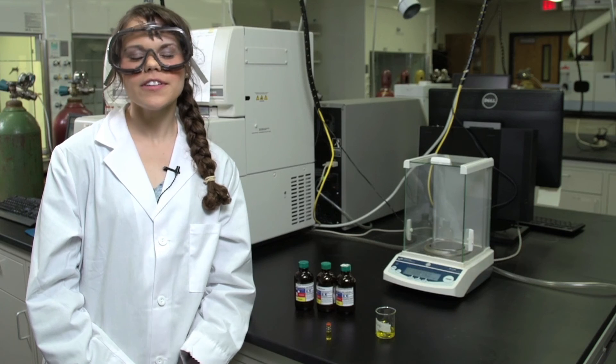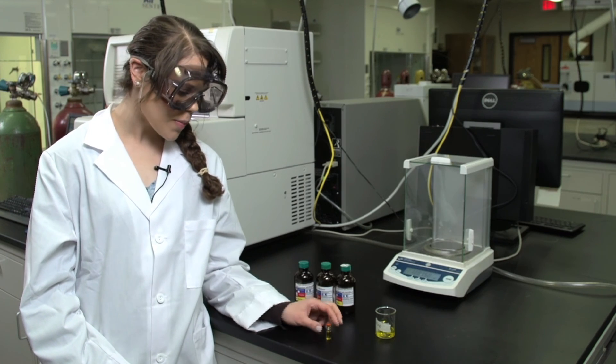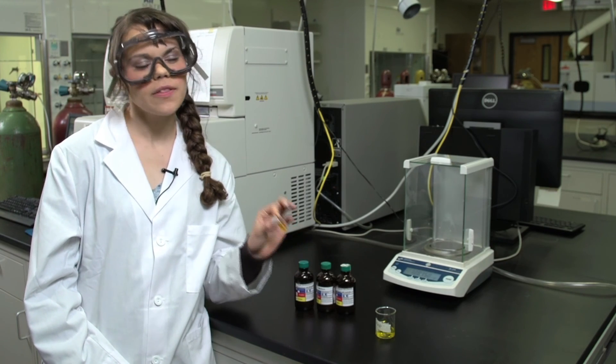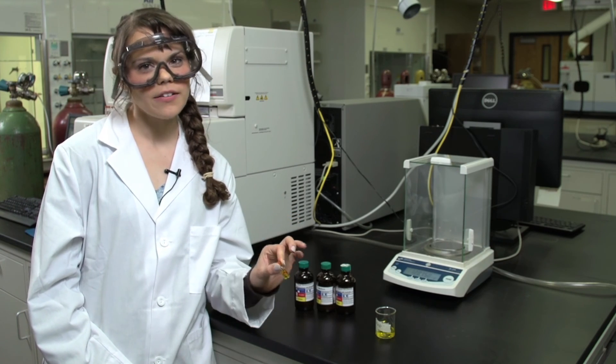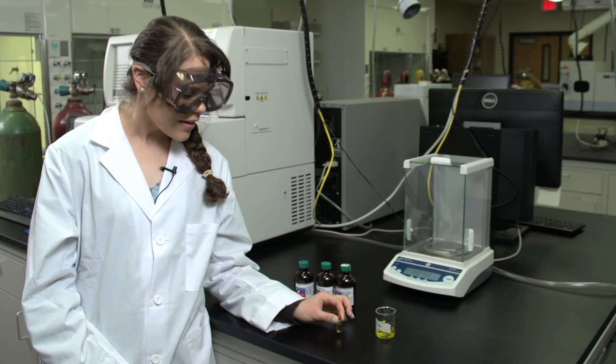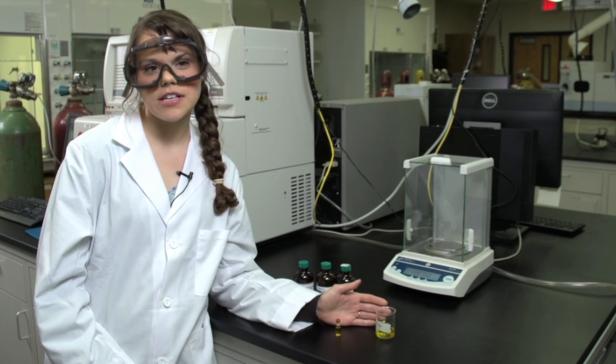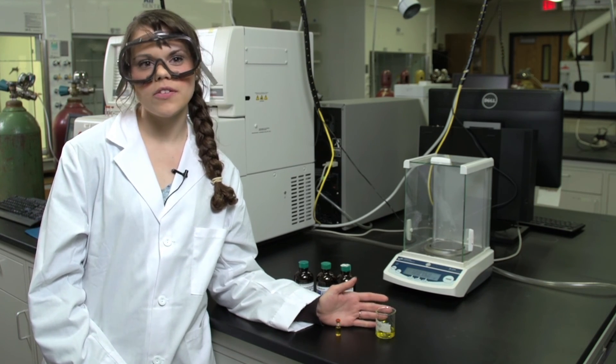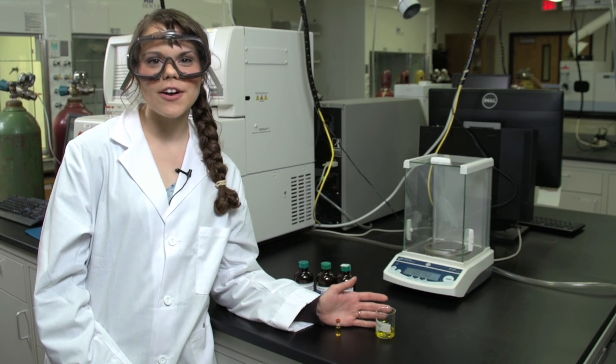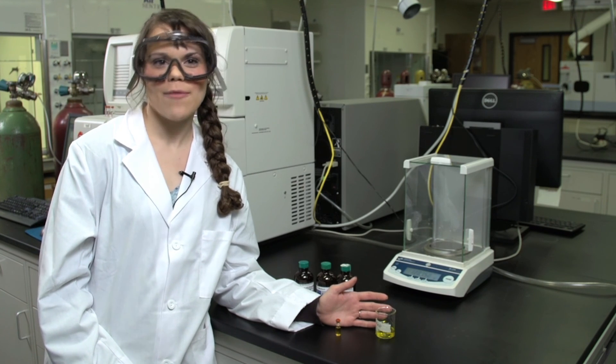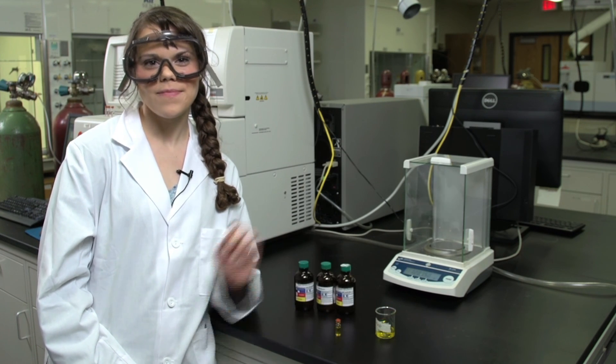To clean up for this lab, you can dispose of the vials and place these directly into the red sharps bin. If you have any remaining solutions in either volumetric flasks or beakers, these need to go in the waste container labeled capillary electrophoresis.